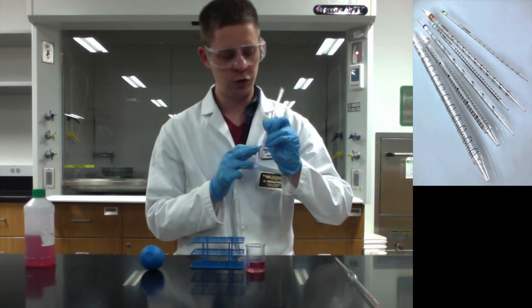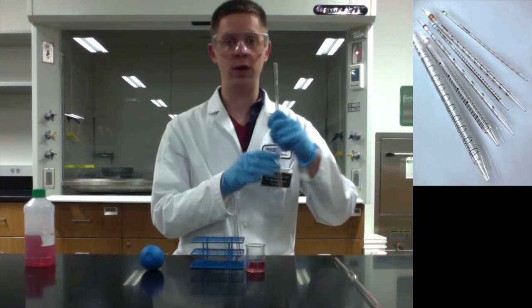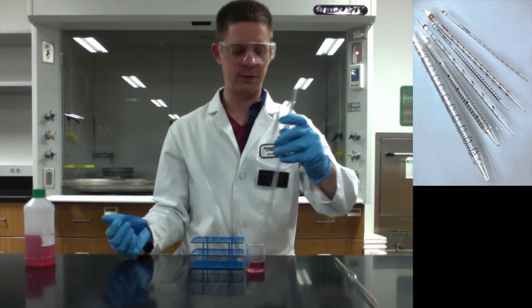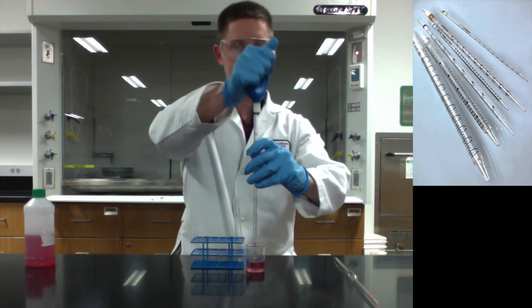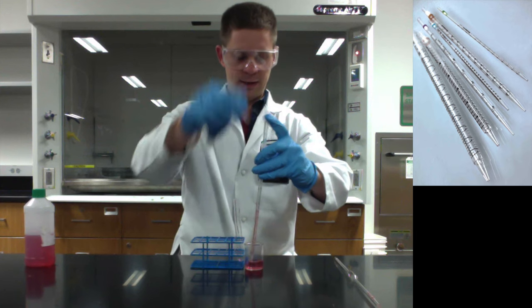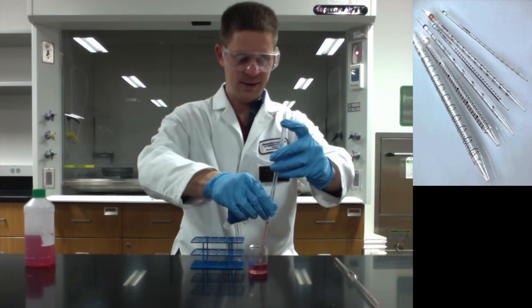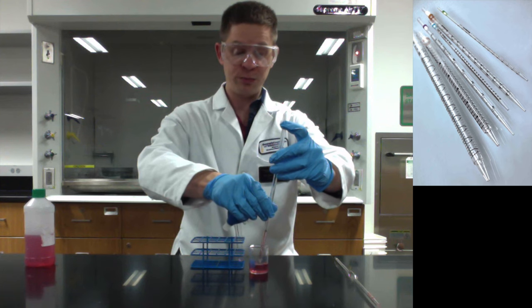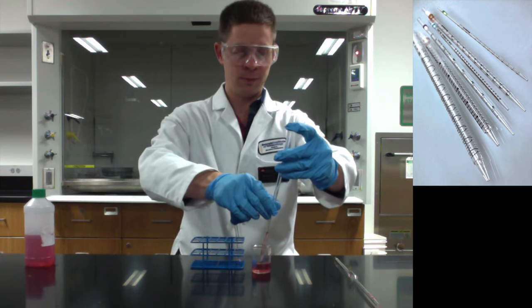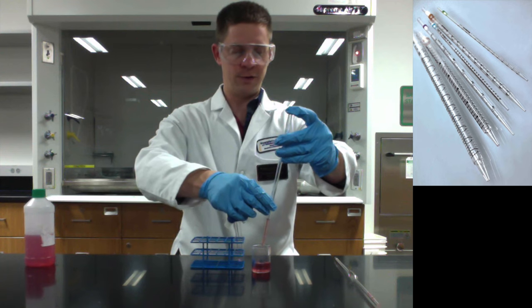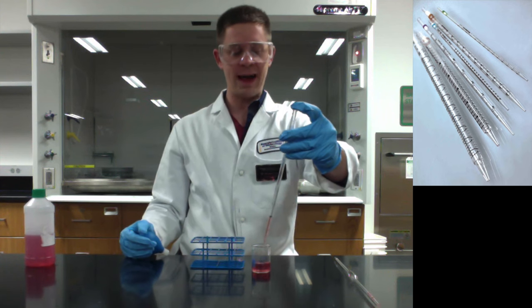Here's one, two, three, four, etc. So another way to deliver 2.6 milliliters from this thing would be to pull up and then get the liquid level at 2.6 initially. 2.6 using the smaller scale, the one that's counting down as we go from the top to the bottom. Not the larger numbers, but the smaller numbers. So right now I have it at 2.6.